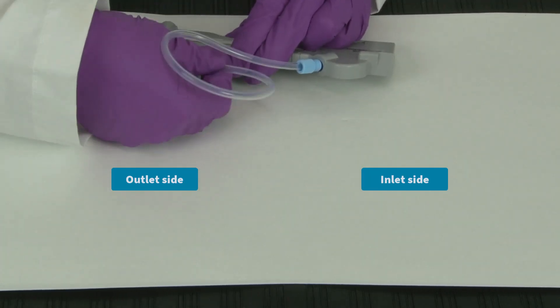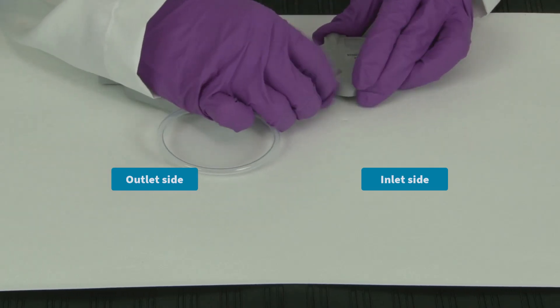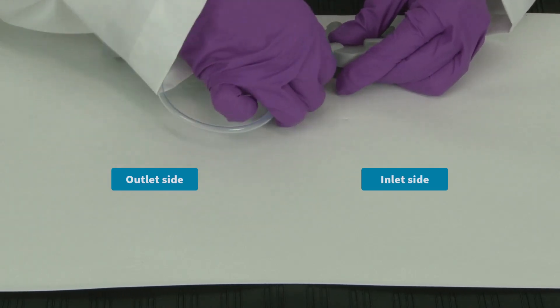Finally, tighten the light blue nuts on both sides to finger tight. Do not over-tighten.